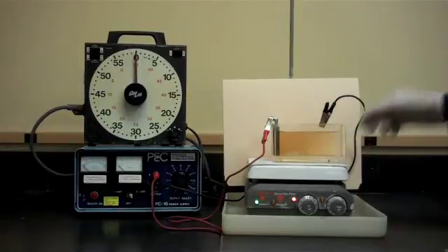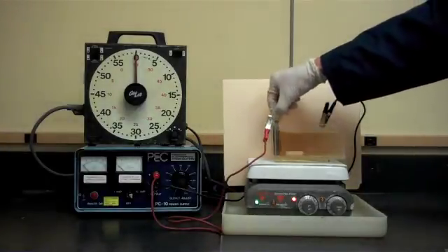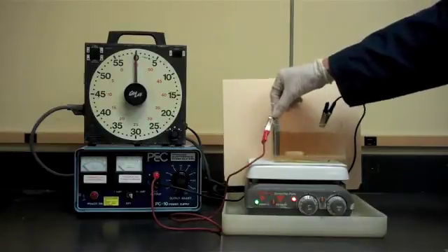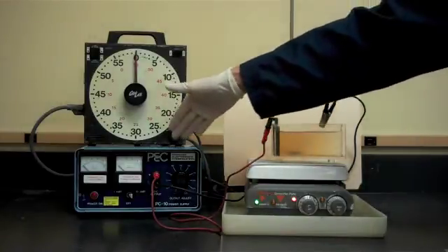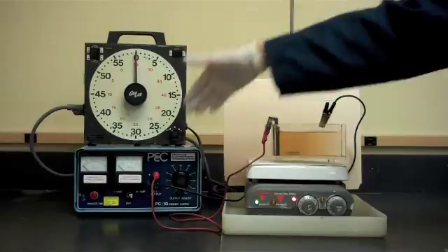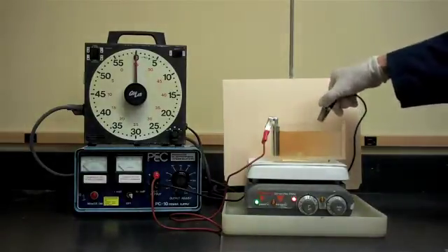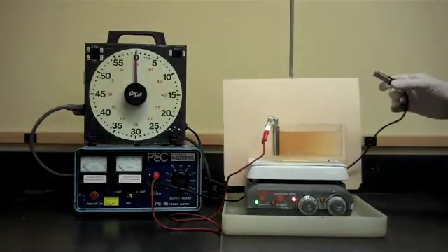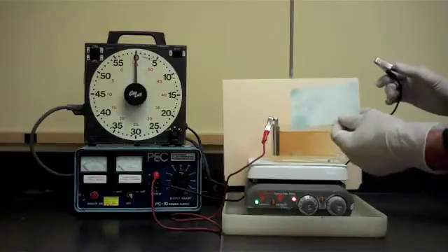The Hull Cell container has an anode which is connected to the positive lead of the power source, and it has a negative lead which is connected to the Hull Cell test panel.